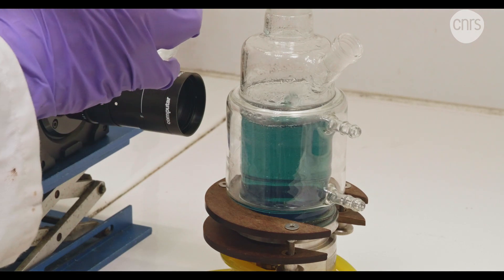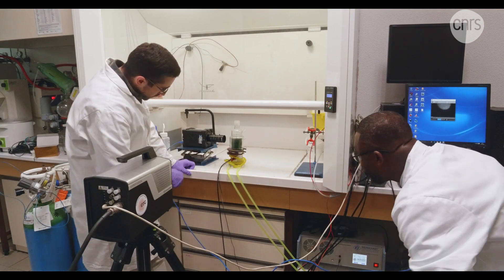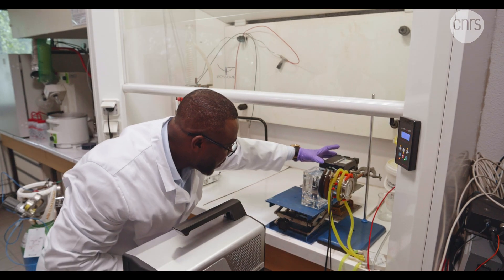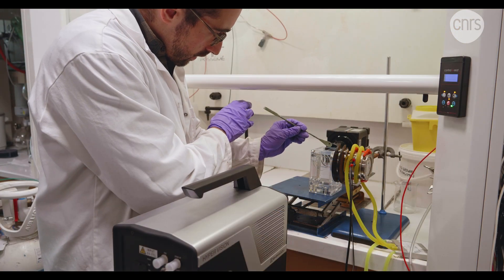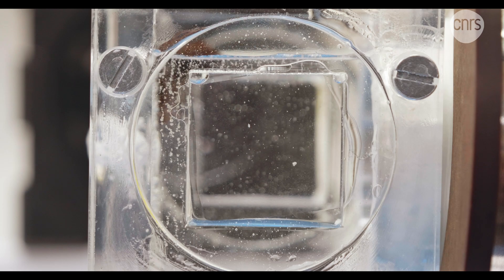We are also performing high-throughput experimental investigations to assess how cavitation bubbles are formed and where they are formed, and this will allow us to control the behavior and dynamics of cavitation bubbles to perform chemistry. When we prepare our catalytic cavitation agent, we use an ultra-rapid high-speed camera to visualize the formation, growth, and collapse of cavitation bubbles in situ. In this way, we can have an idea of where the cavitation bubbles form on the surface of the catalytic materials, and this allows us to control the bubbles and the kinds of reactions we perform with this technology.